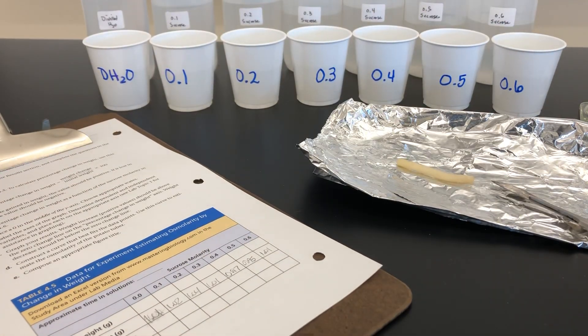We'll soak these and let you see the results after they're done doing diffusion and osmosis.